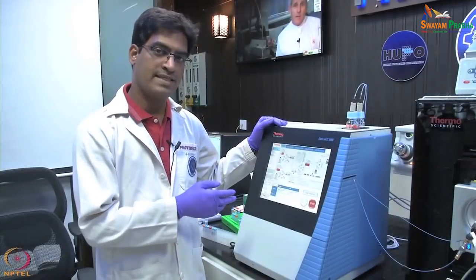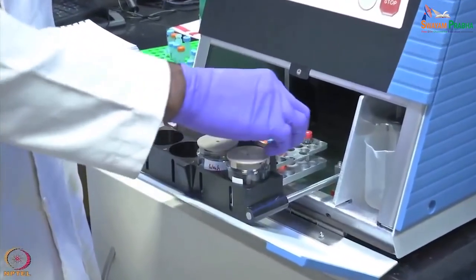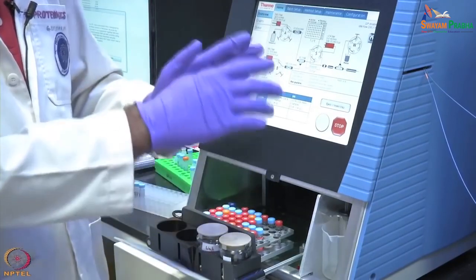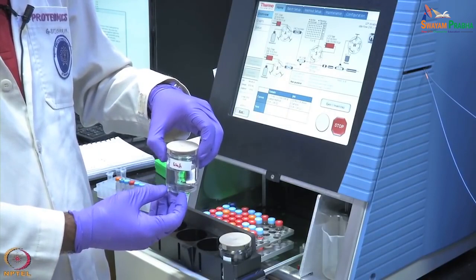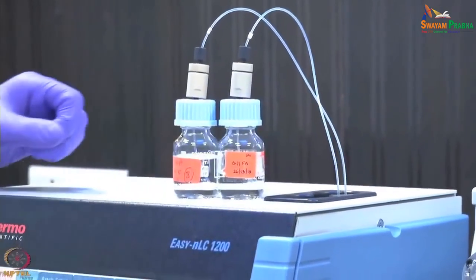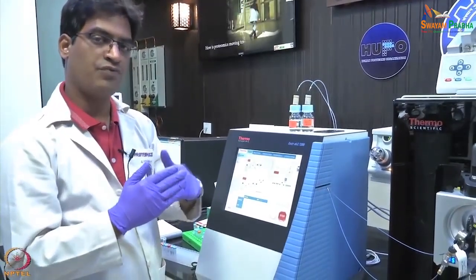We now look at a Nano-LC system: the easy Nano-LC 1200 setup. This assembly has a 48-well slot where vials containing the sample to be analyzed are placed. A needle inside picks up the sample from the designated slot and injects it onto the column. There are two separate bottles—one for washing the needle after sample pickup and one for discarding waste. On top of the unit are two solvent slots: solvent A contains 0.1% formic acid and solvent B contains 0.1% formic acid in 80% ACN. The ratio of these solvents determines when the peptides elute from the column.